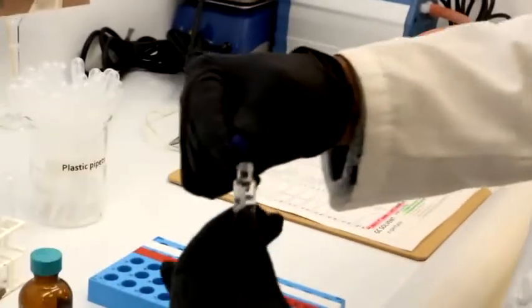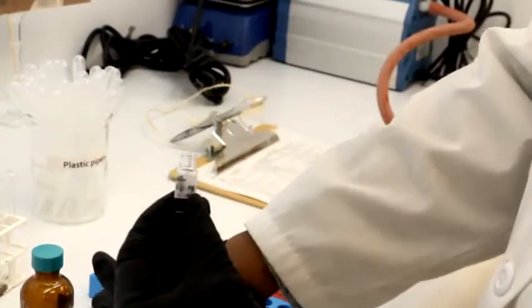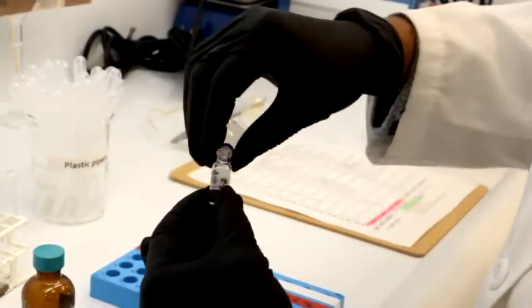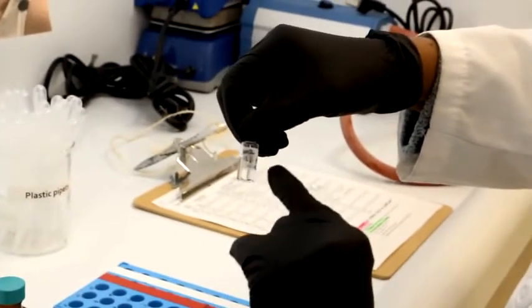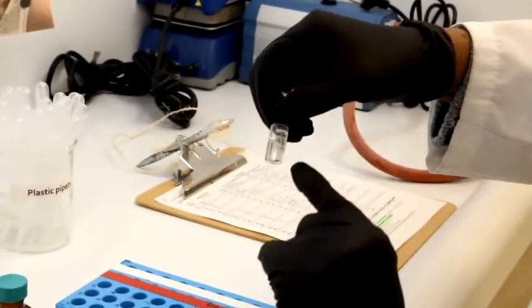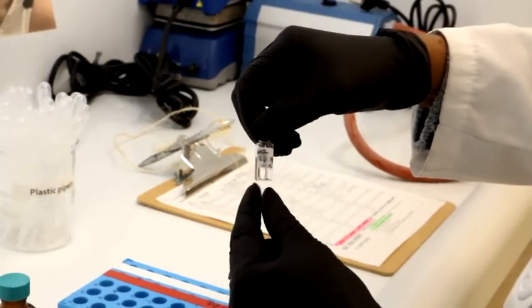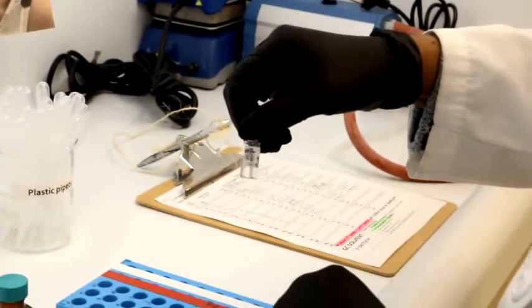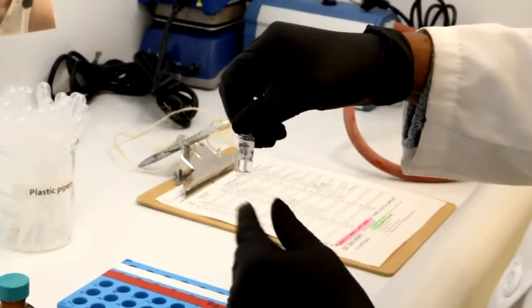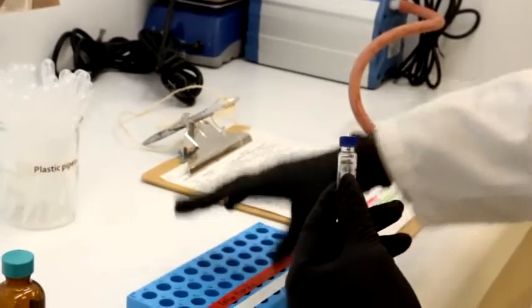Now, prior to filling with your sample and your GC solvent, you should have labeled this. It got smeared, but you should basically label it with your name, in terms of your different lab partners. You also want to put the time frame of your lab, and you also want to put your TA's initials here. And very, very similar, it's actually the same thing.